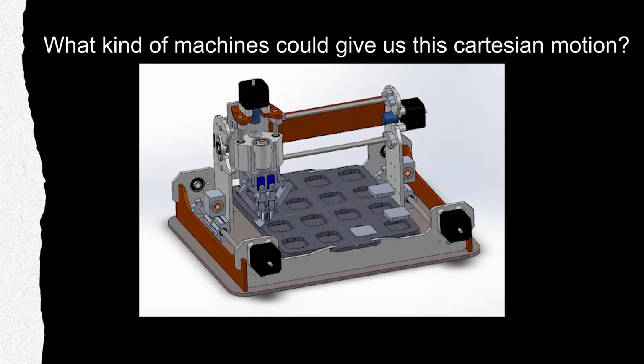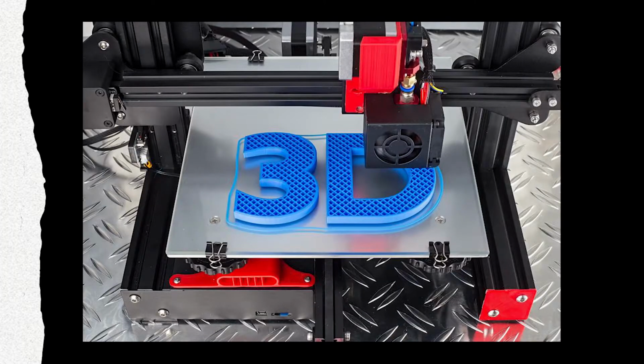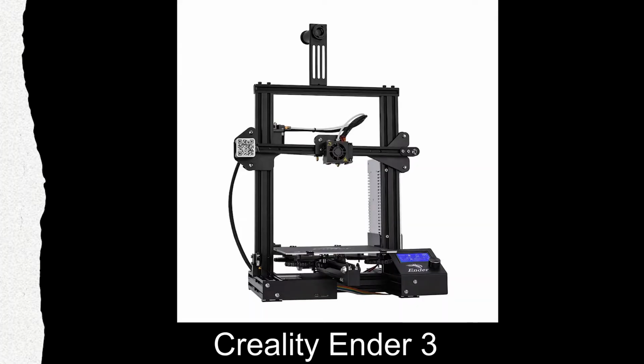What kind of machines can give us this Cartesian motion? Well, our first option was a Cartesian robot. These are commonly used in high-precision automated manufacturing spaces, more specifically pick and place. We found a Cartesian robot that we liked, but at around $10,000, it is a bit out of our price range. So the next challenge was to either find or design something cheaper. Now, as it turns out, 3D printers offer the exact same type of motion with the added benefit of extremely good precision in the z-axis. This allows us to really fine-tune our application force. After some research, the group decided on the $200 Creality Ender budget 3D printer, certainly a far cry from $10,000.